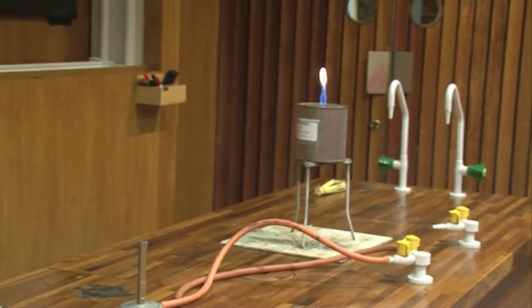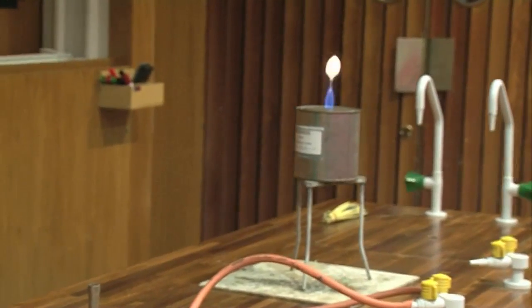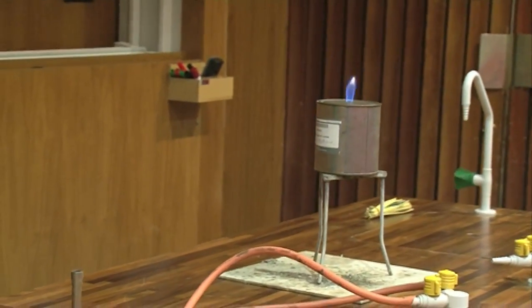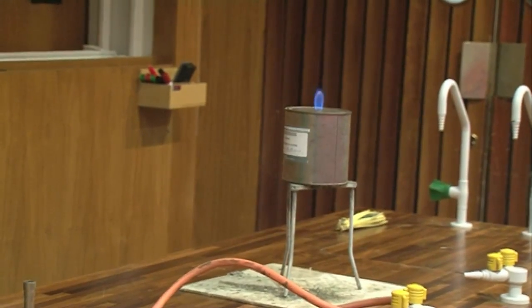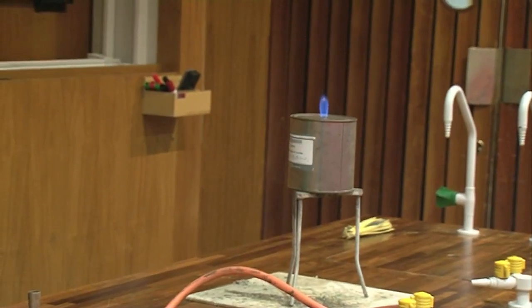So what we're looking for now is the flame on the top. It's getting smaller and smaller and smaller as the burning methane gets less and less and less. And then, hopefully, that flame will pop back inside the vessel and pop! Let's see.